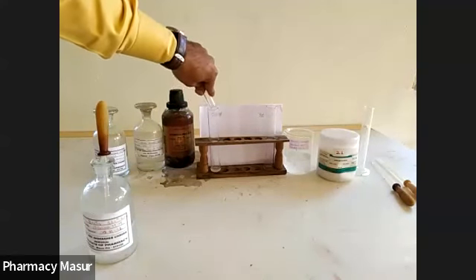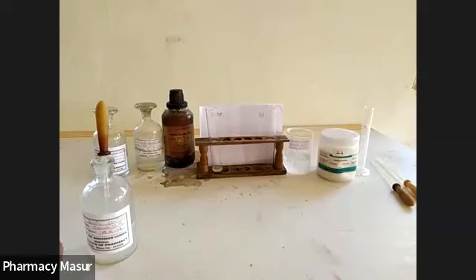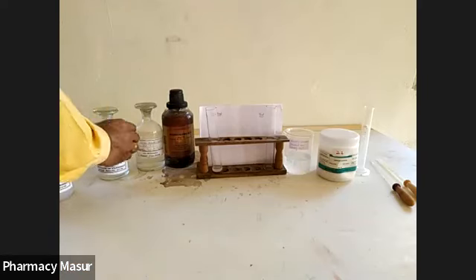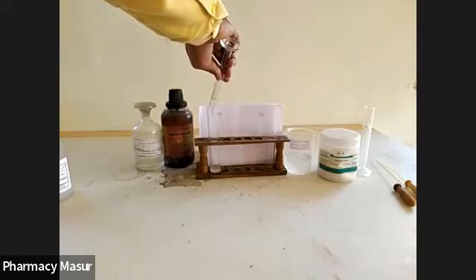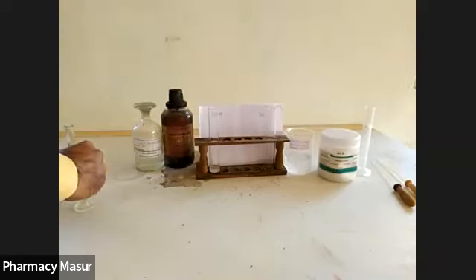Okay. So we want to prepare the standard, and this is 1 ml of barium chloride solution. Next, after it, 1.5 ml of ethanolic sulfate solution, which is prepared here. We have to add 1.5 ml of ethanolic sulfate solution, which contains standard sulfate molecules in it, and it has been added here.